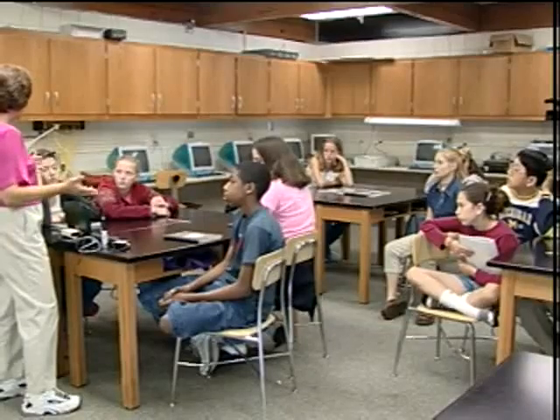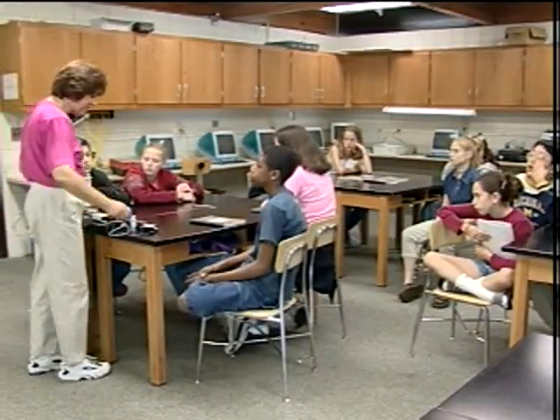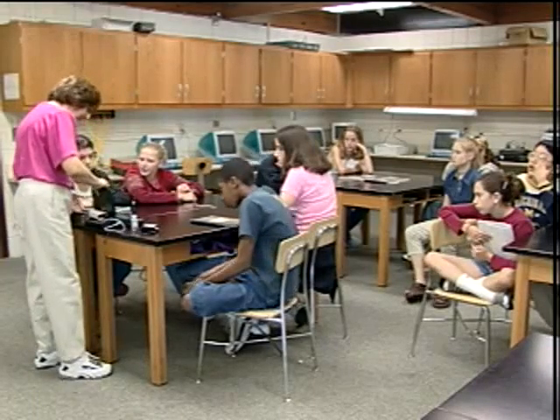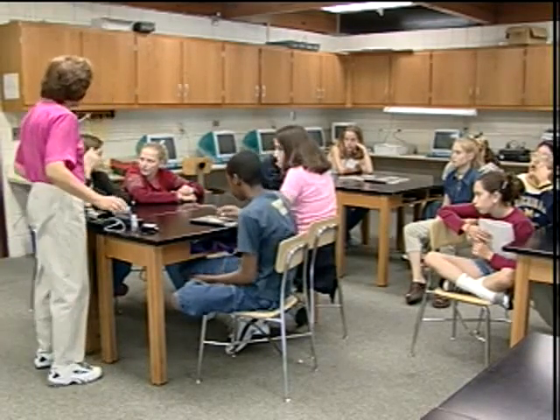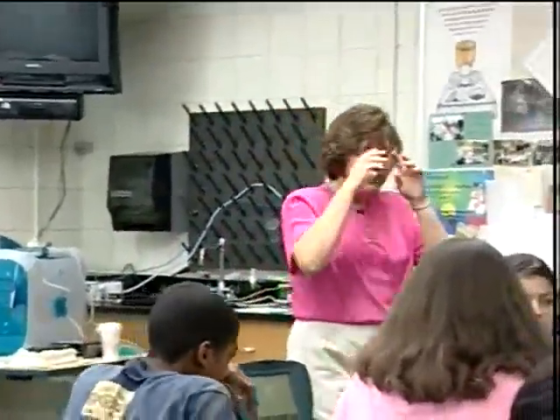This 7th grade science class has been conducting a year-long study of the water quality of a nearby stream. In this activity, they prepare for their research by calibrating their probes. So really what we're saying is we need to calibrate this. We need to transform these numbers that come in as volts initially into something we can use, something that's readable and makes sense for us, okay?